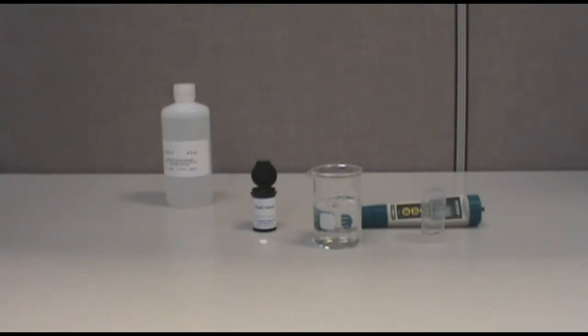Today we will be showing you how to calibrate and use the Extech Fluoride Meter. The meter comes with a sample cup and reagent tablets used for calibration and measurement. You will need to provide a 1 part per million fluoride standard.